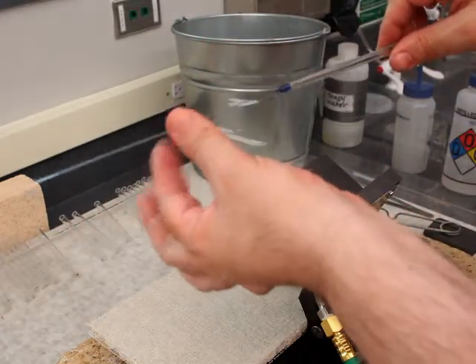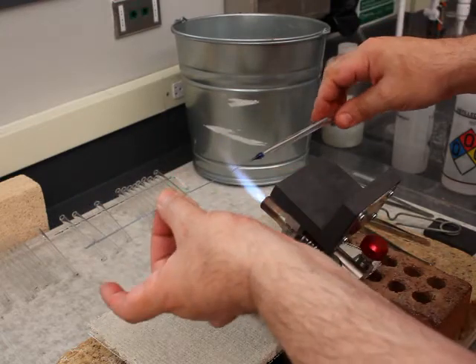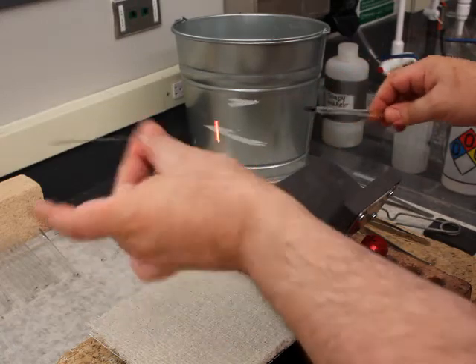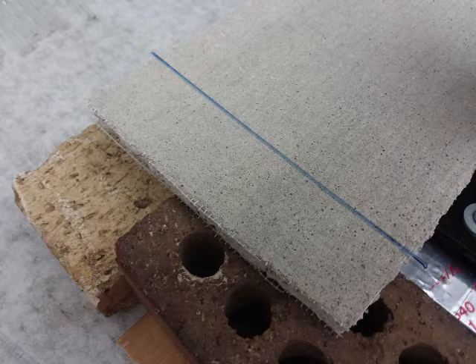This fiber is about 1 millimeter in diameter, just slightly less than that. That's actually kind of thick for some of the applications that we use this type of fiber for. When I was in graduate school, I would pull glass fibers of different diameters and use them for X-ray crystallography, for transferring crystals into capillary tubes. This would actually be way too thick for it. I'd want something about half that diameter.